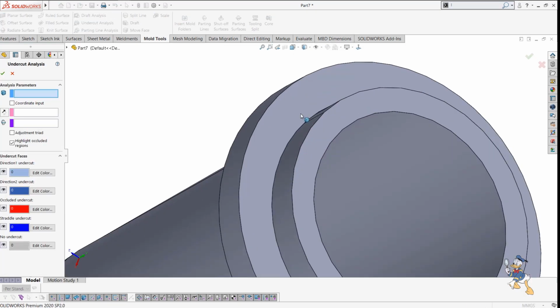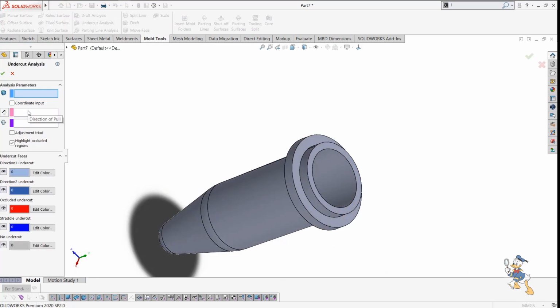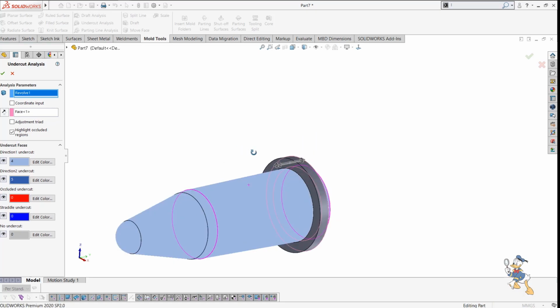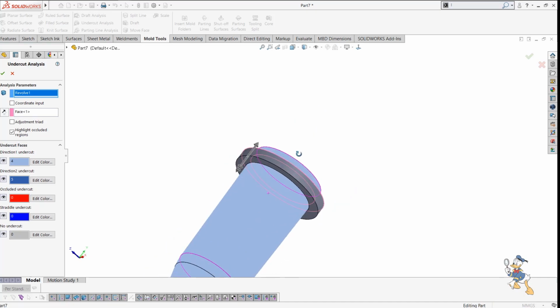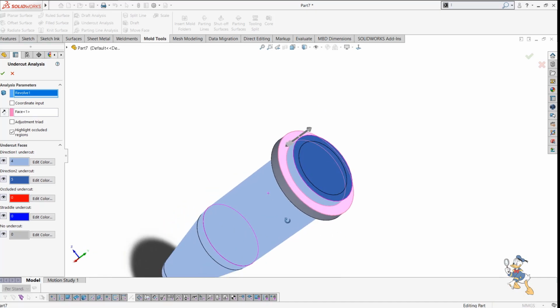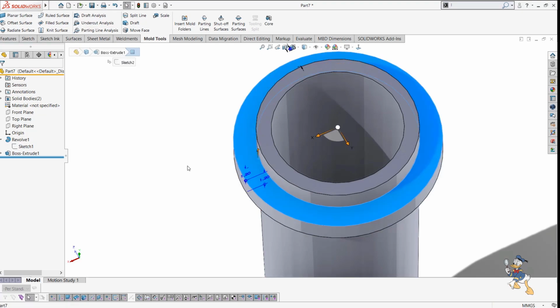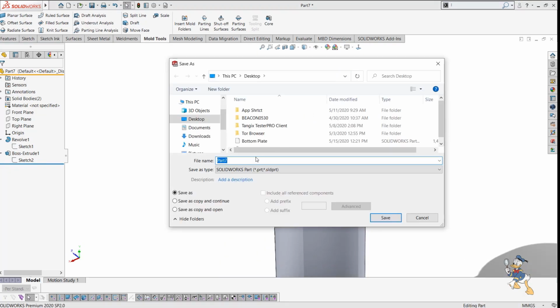Suppose you need to check some undercut analysis, you just need to provide a face about which we can check it out. The direction of pull is this, the solid body is this, and we can check the undercut analysis. And the direction of undercut is, as you can see, there is no undercut in this figure. So it is very easy to design some sort of design like this, and now we can save it with some name like 50 mm tube and text.